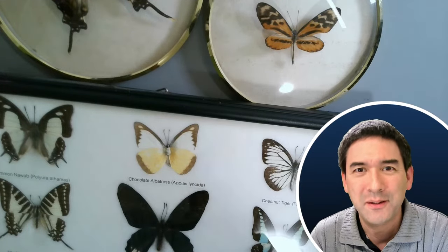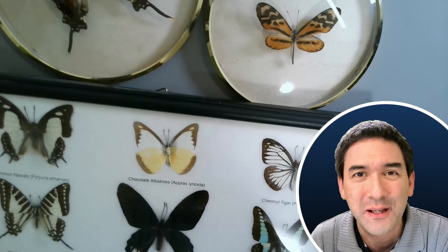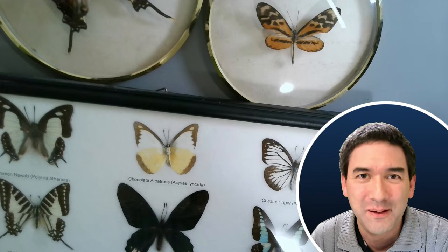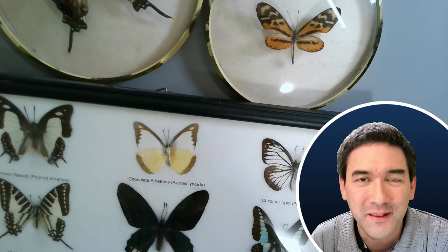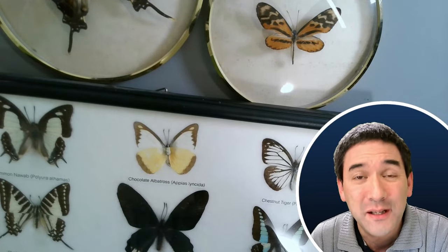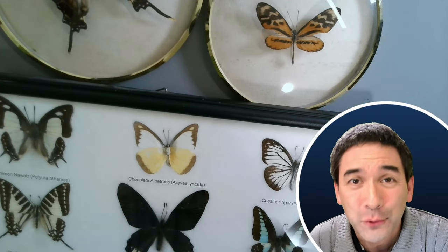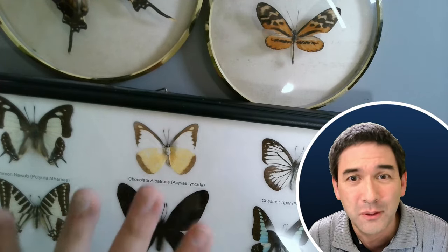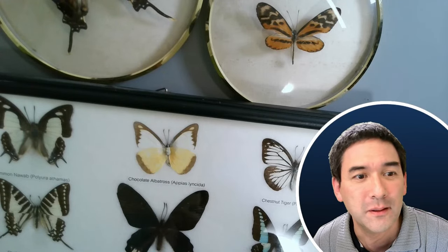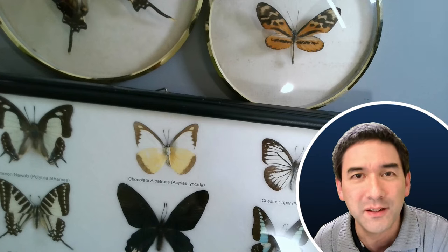Hello everyone, MicrobeHunter here again. Welcome to another Saturday microscopy live stream. In today's live stream, I'm going to talk about different topics. I would like to put some of those butterflies under the microscope.